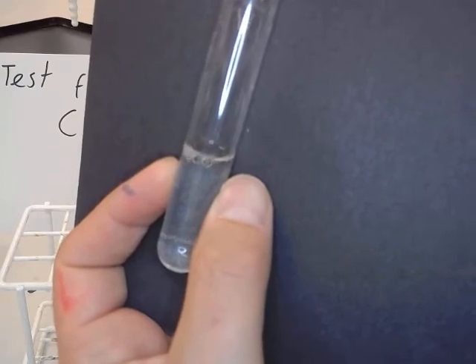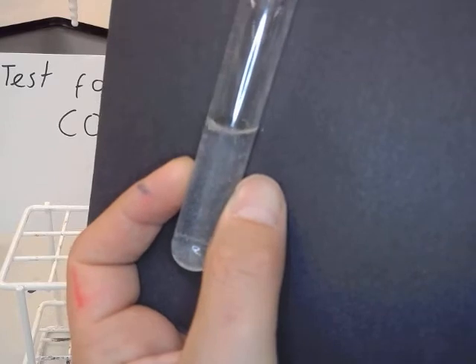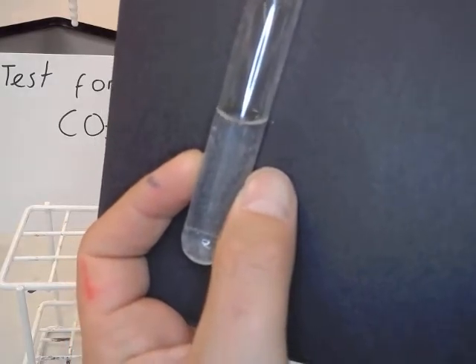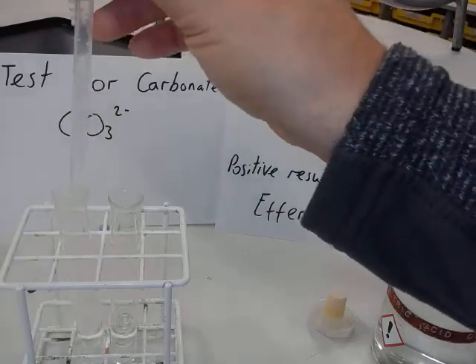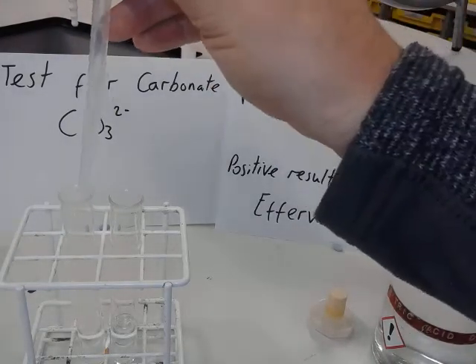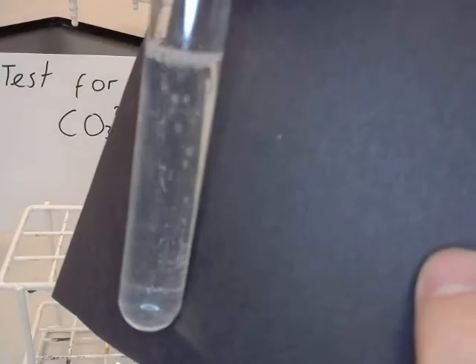There, now, do you see those bubbles there? It's definitely bubbles. That's not just them mixing, that's it reacting. There you go, definitely see some bubbles there. Right, now I'll add a bit more nitric acid to it. So there's effervescence there, therefore I can say, there you go, you see that bubbling away there now. Okay, it's making CO2, but the observation will be effervescence or bubbling.